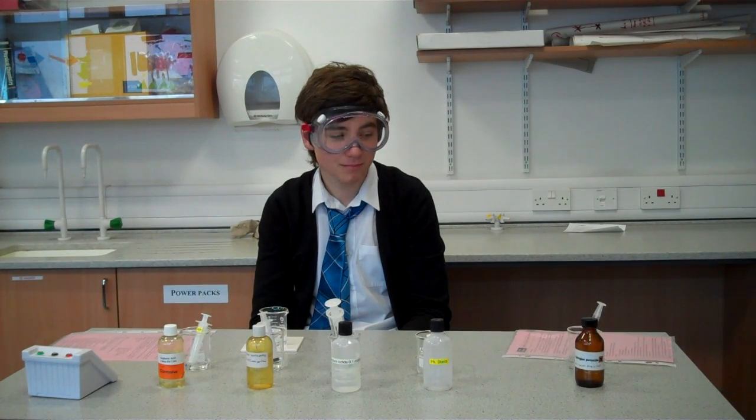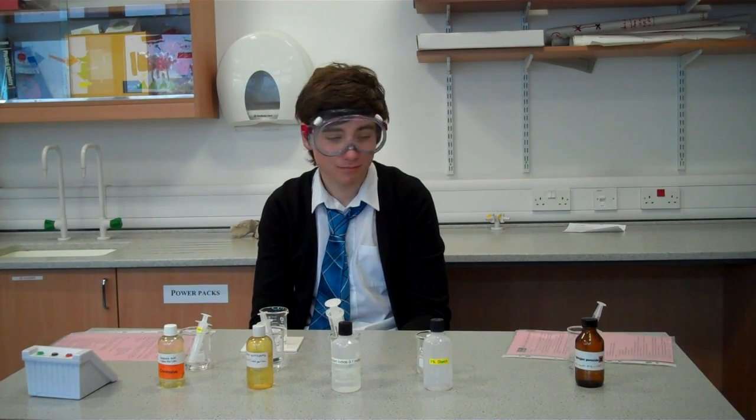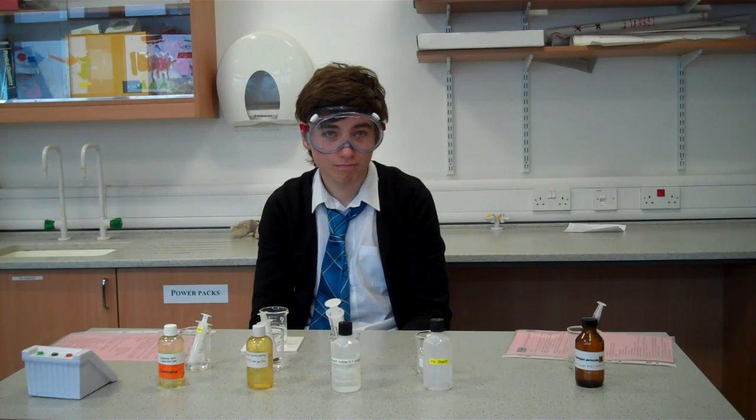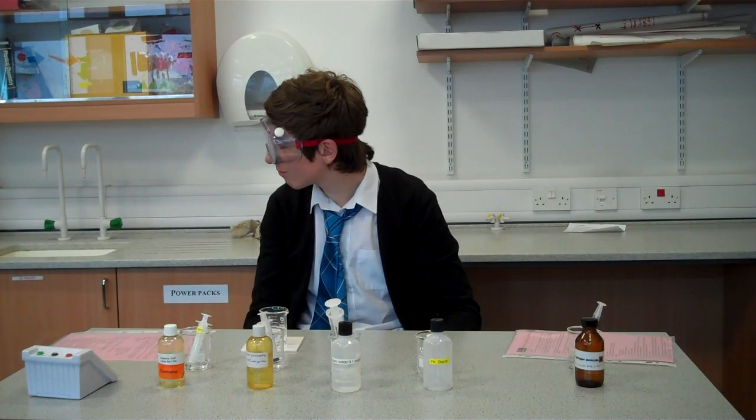The effect of concentration of potassium iodide on the rate of the reaction with hydrogen peroxide. We have added all the required chemicals into the beaker.